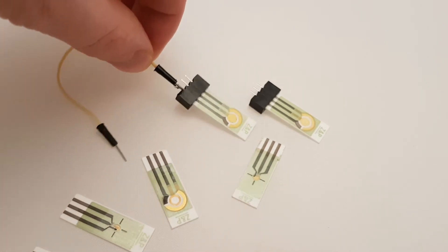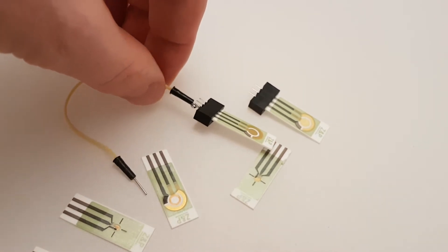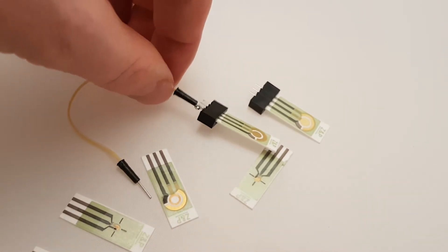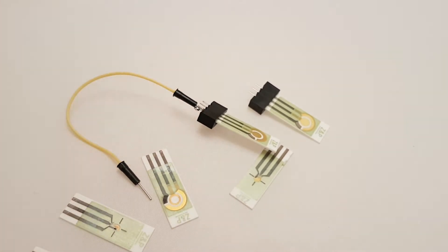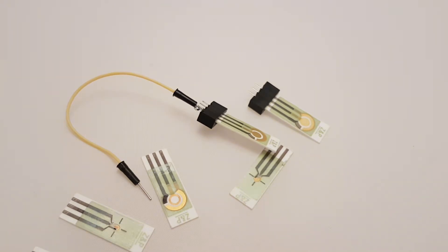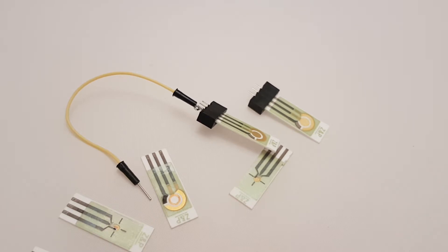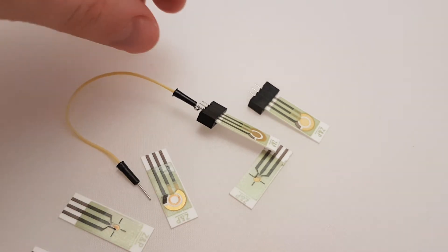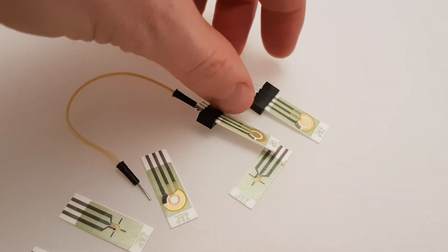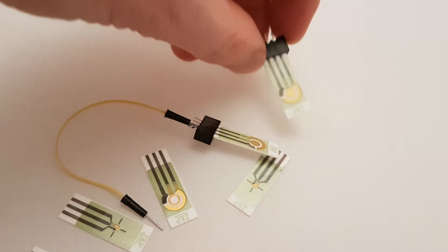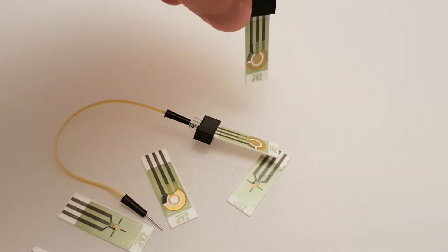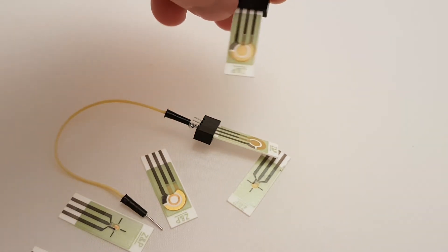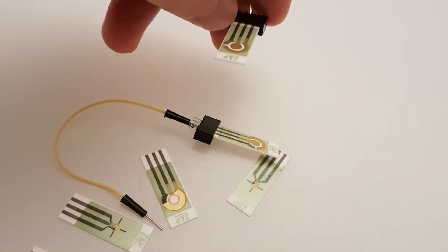So it's just to say that's one way of making a quick electrical contact with a gold electrode. I think this video goes alongside another video we have where we show how to turn one of these thick film printed electrodes into a probe electrode. You can put these into a probe format and then the question is how you're going to actually make electrical contact with it.